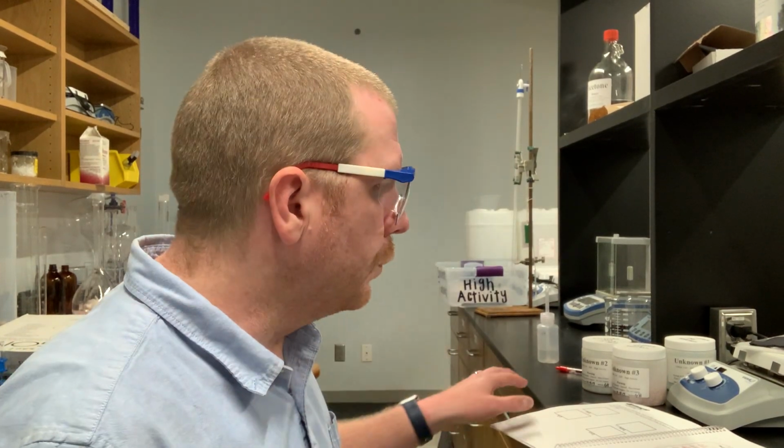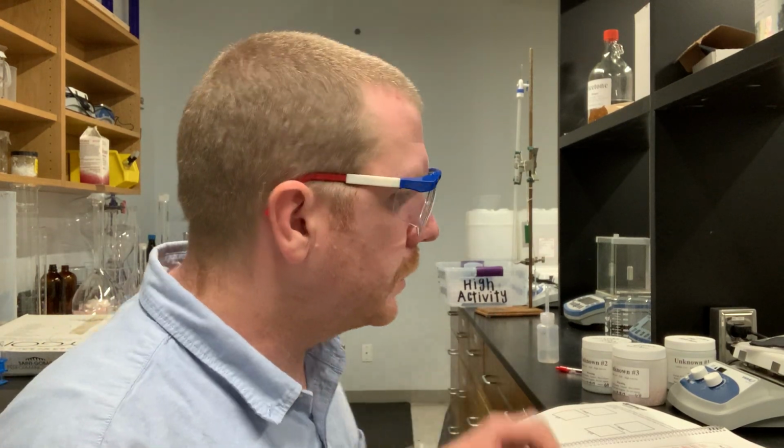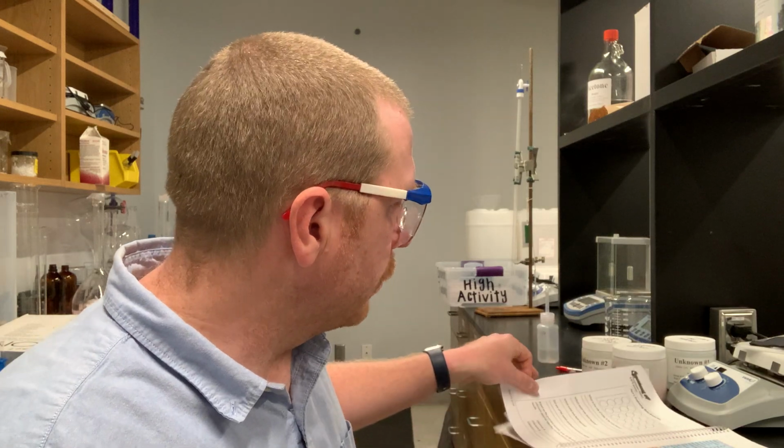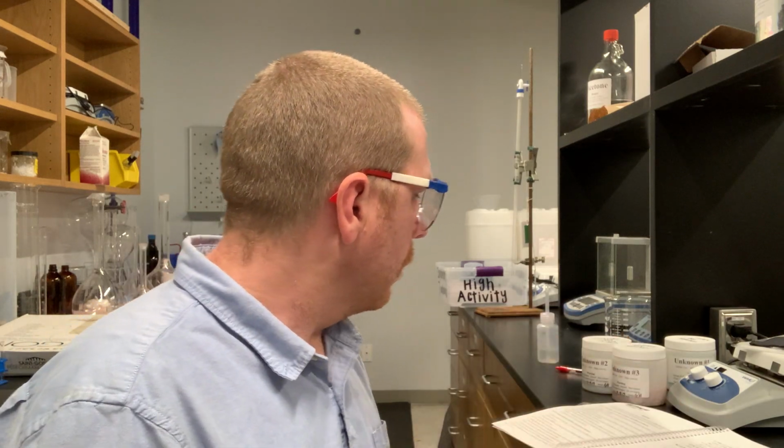All right, so now we're moving on to part 2 of the procedure. Part 2 of the procedure involves mixing soluble solutions. So there are a total of 4 different solutions that we're going to be working with for part 2. Now, we are classifying our solutions as strong bases or non-strong bases. So that's all that we're doing.